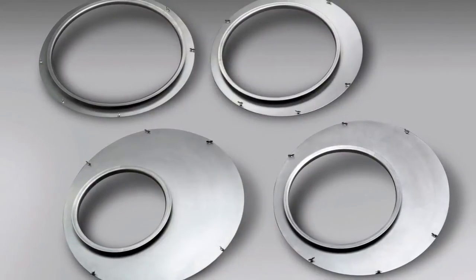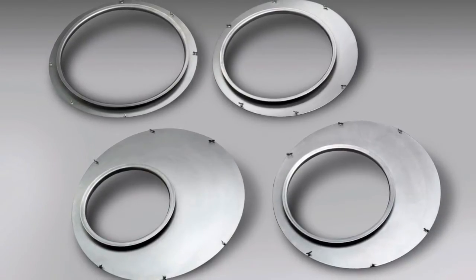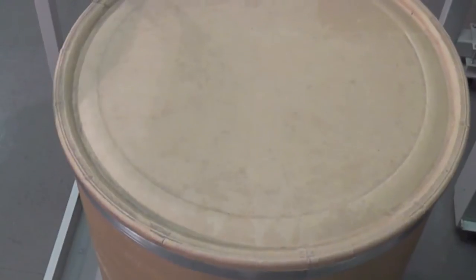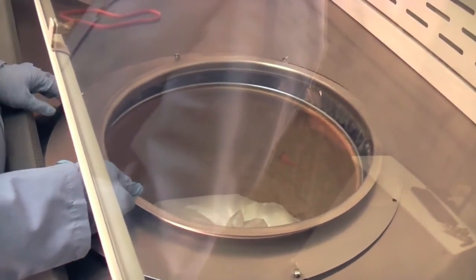Retaining rings come in four standard sizes: 11.5 inches, 14.5 inches, 17.5 inches, and 19.62 inches outer diameter. These rings mount to the work surface and secure the safety sleeve and inner source container bag. Select a ring that is slightly larger than the diameter of the source container. Holding the retaining ring flat side down, align the fasteners to the holes in the work surface and fasten.